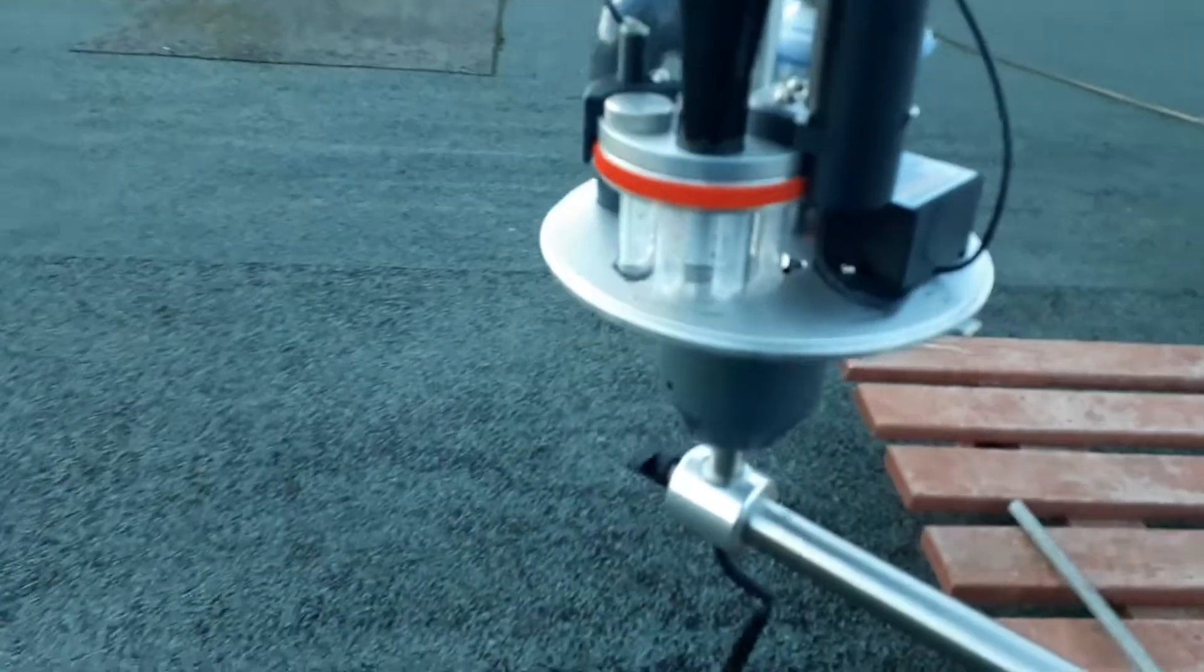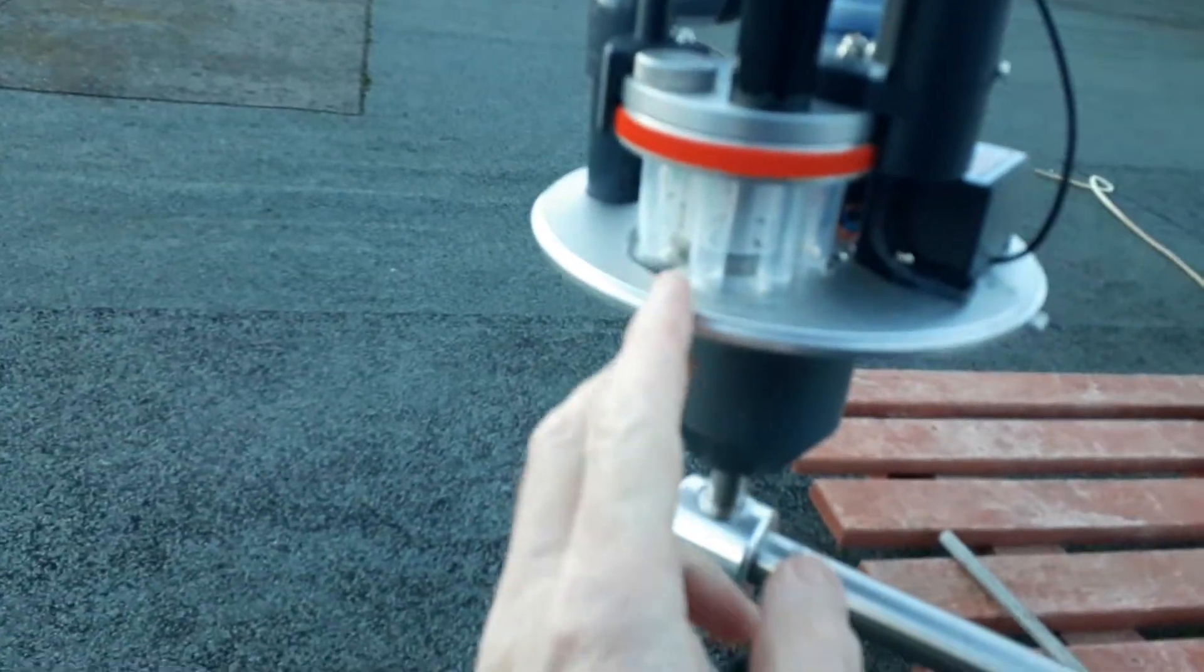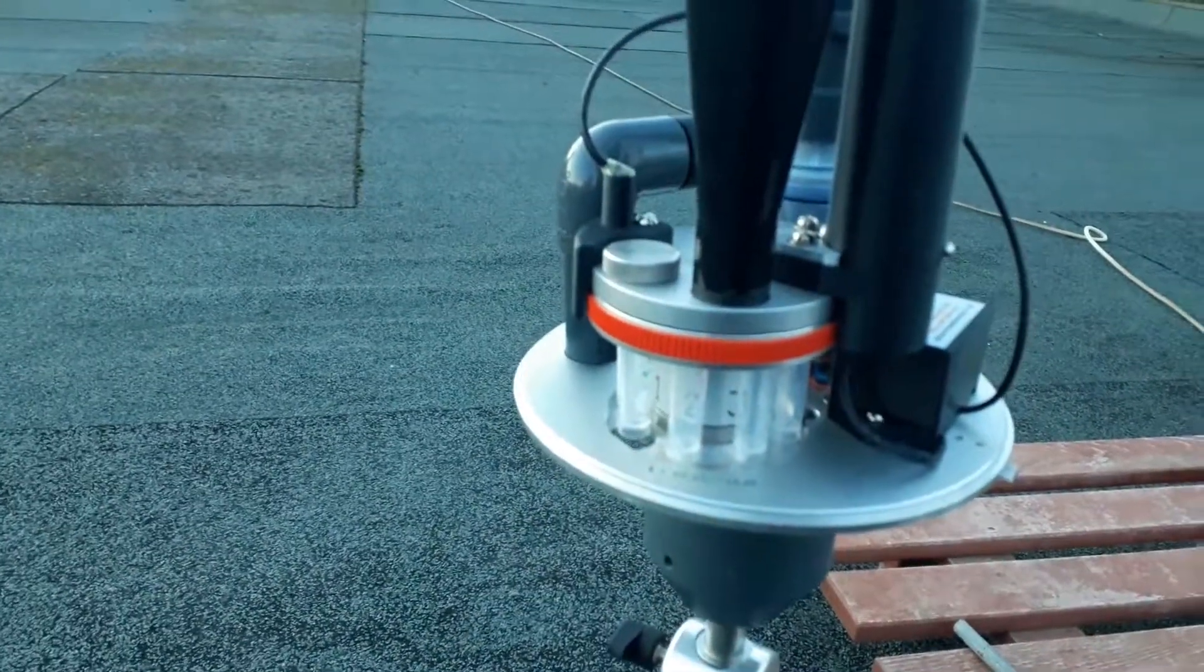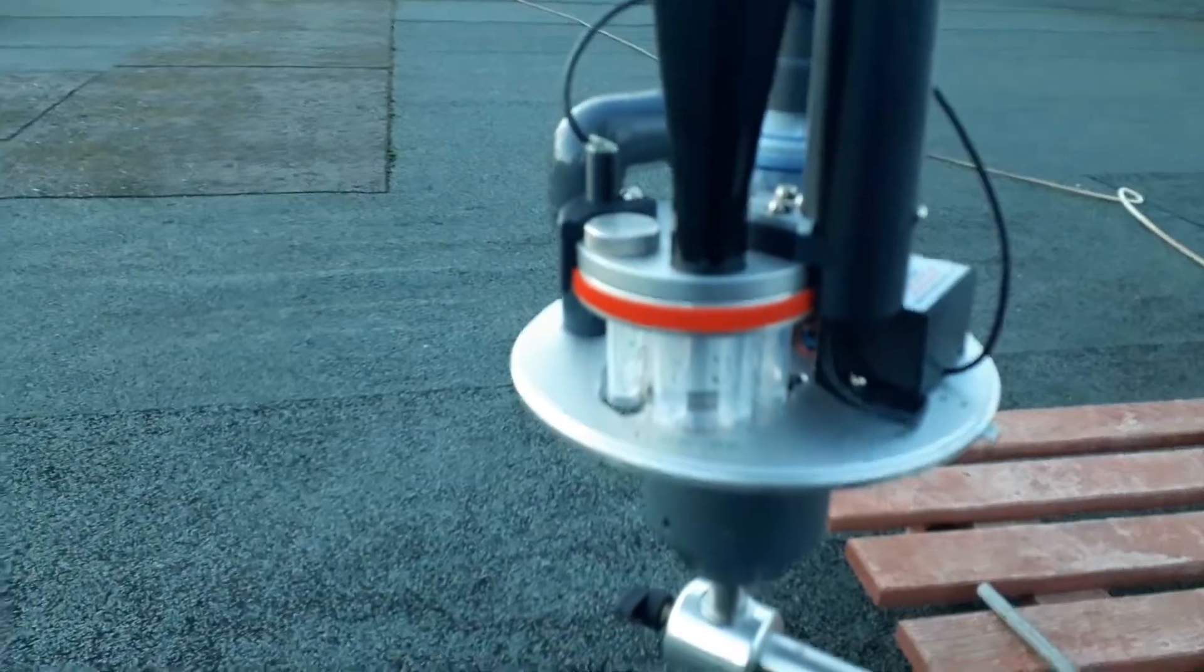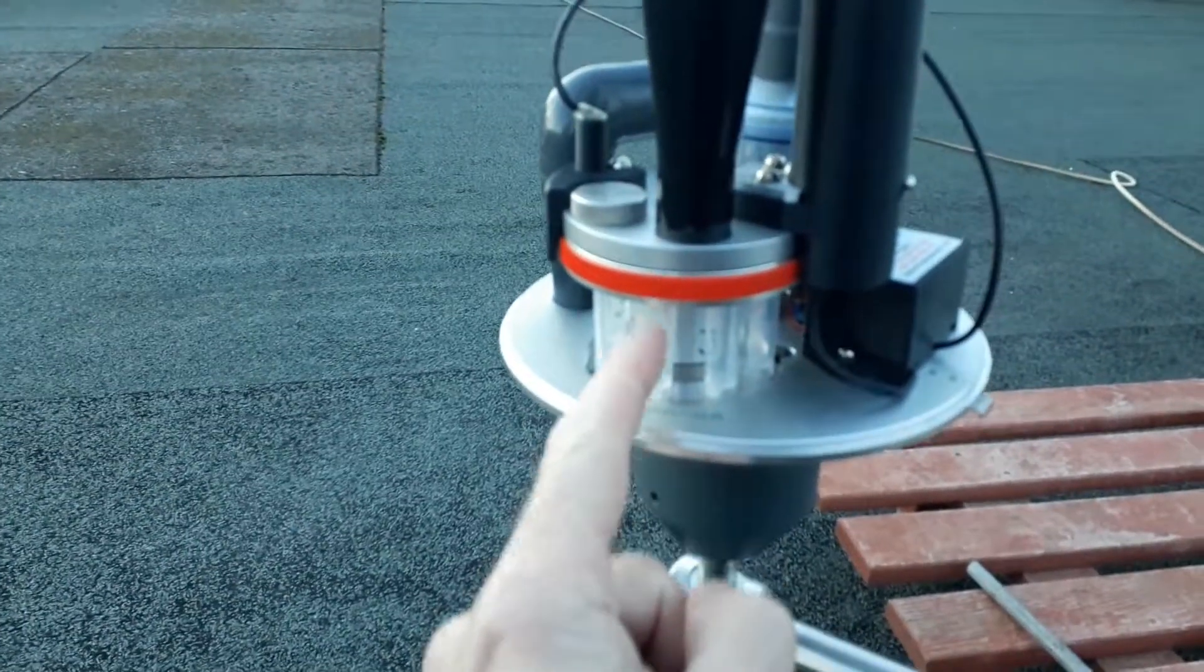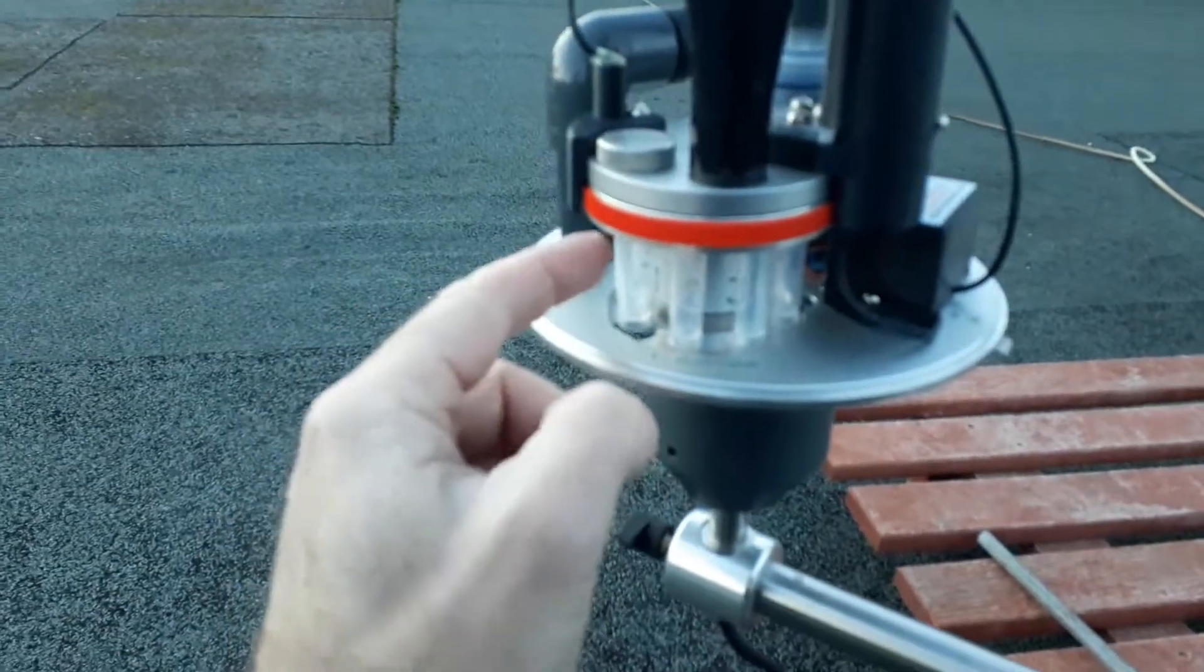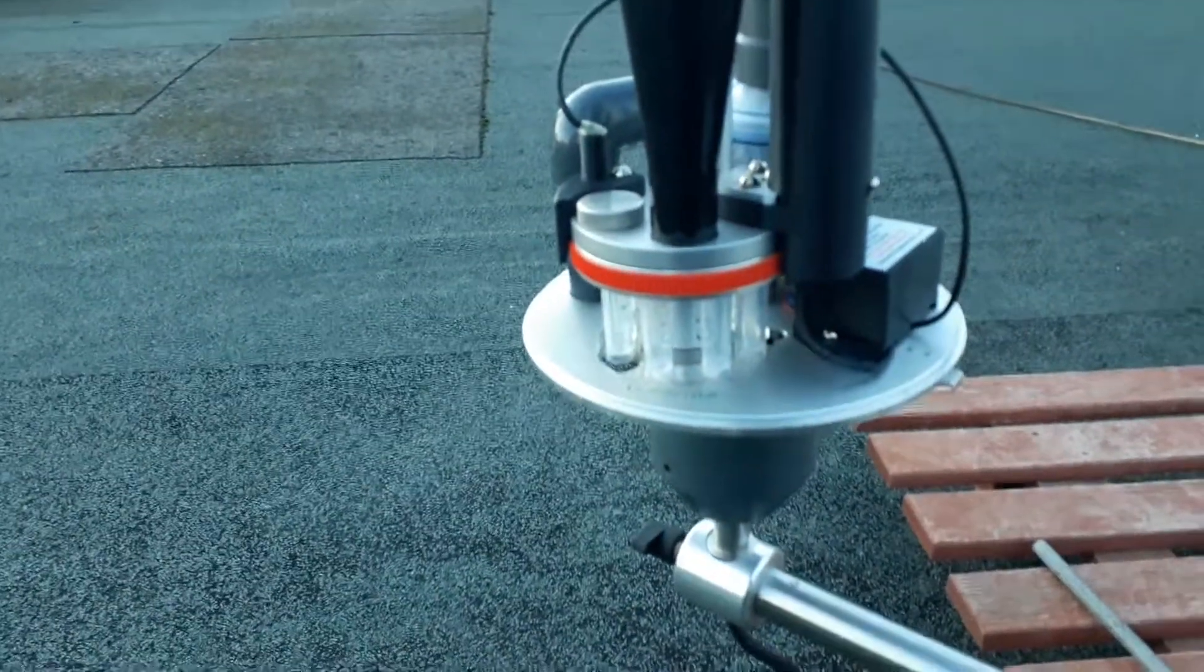now note which tube position it was sampling into. It was sampling into tube two in this case. We need to remember that. We might want to remove that tube and then put it back into position one for when we restart.